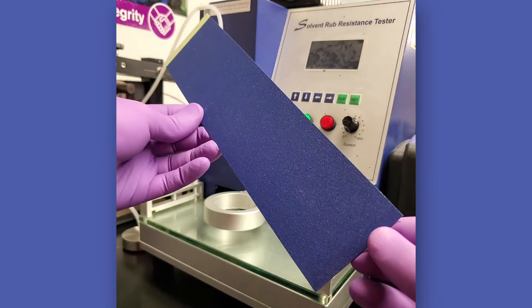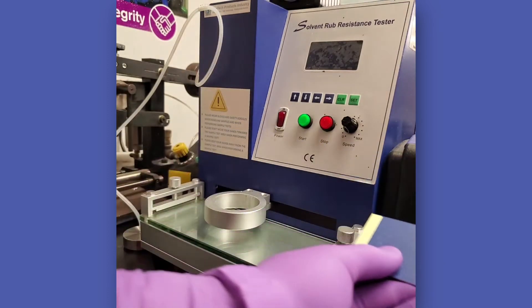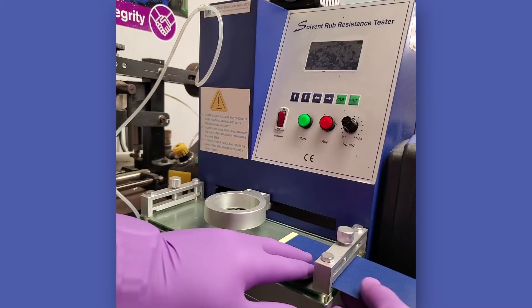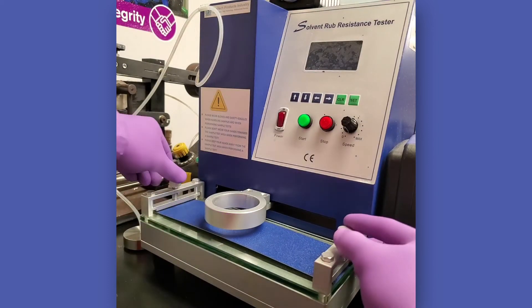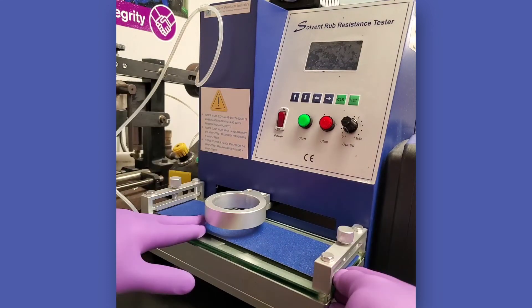The first step is to obtain a representative coated flat panel which has been cut to an appropriate size for the test machine. If possible, use a panel of sufficient length to allow an eight inch long test surface with a one inch width.